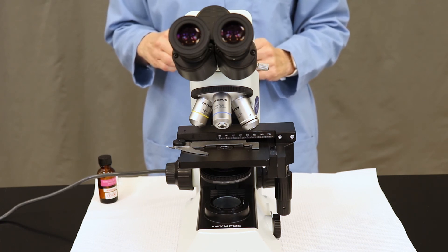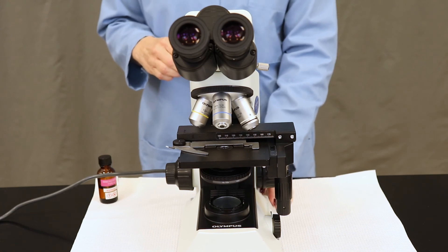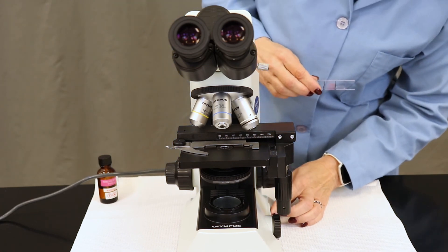To start out, once you locate your microscope and plug it in, be sure to turn on your light source located on the side of the scope.